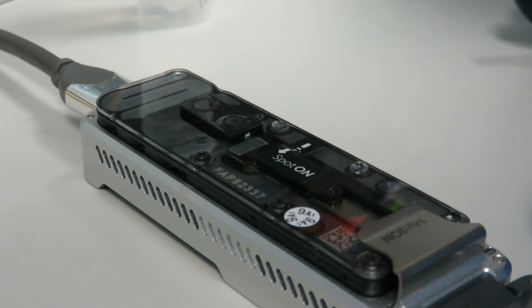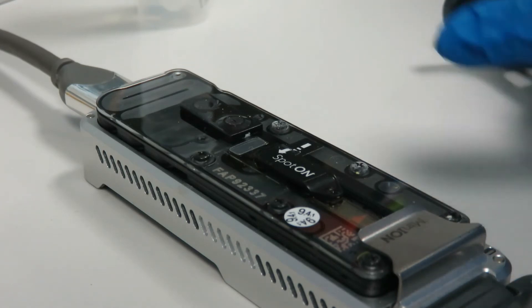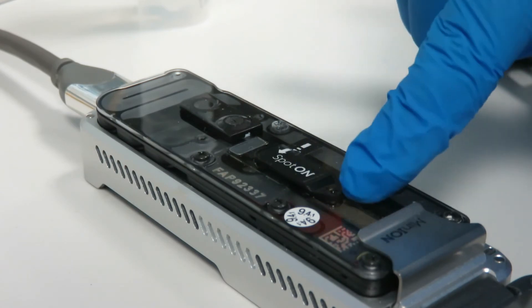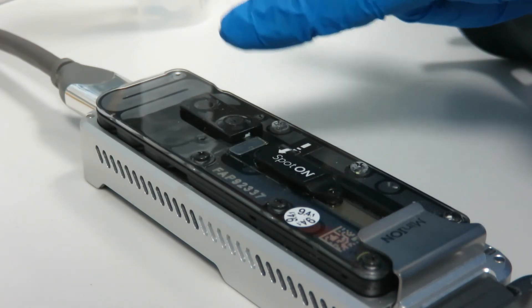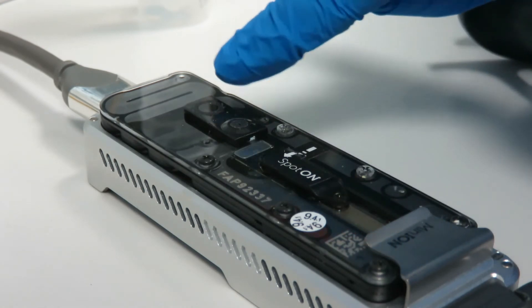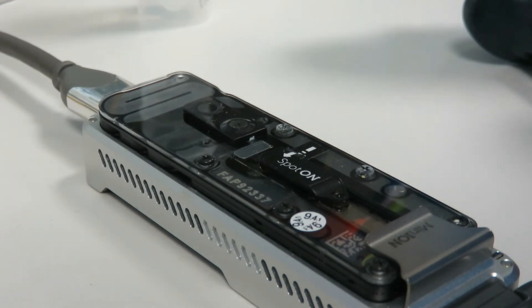It's a bit of a skill when you first do it, but it's helpful to keep an eye on how much you're adding with your pipette and also keep another eye on the channel that runs between the hole and the panel. If you see any air bubble movement between the two, you can stop it before it goes into the panel. You should see that if it's pure water the channel will be dark, and if there's air in it then it will be sort of light gray.